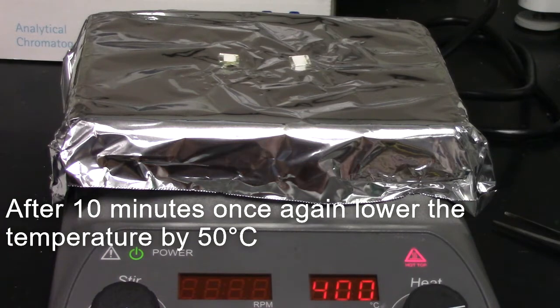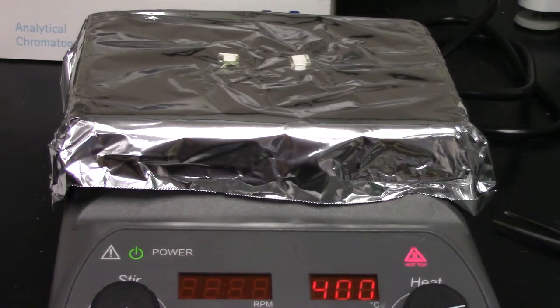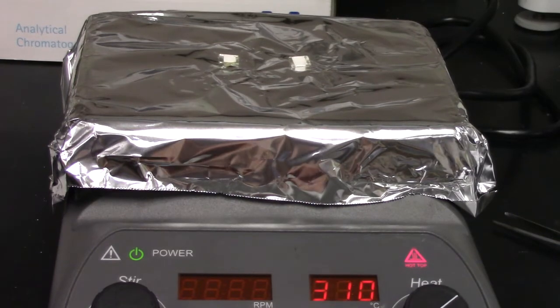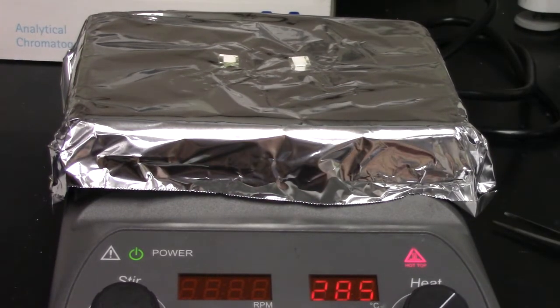Slowly decrease the temperature by 50 degrees centigrade at every 10 minute interval. Repeat the process until you reach the final temperature of 50 degrees centigrade.